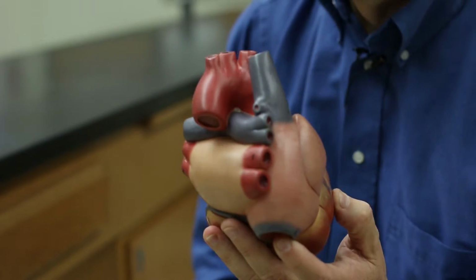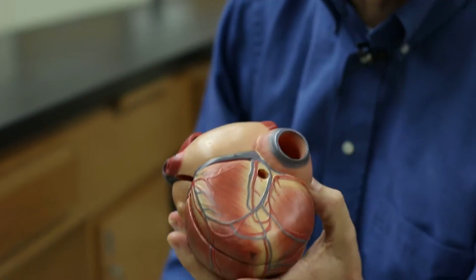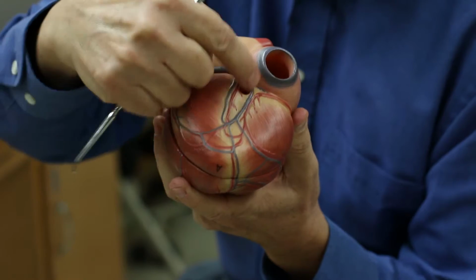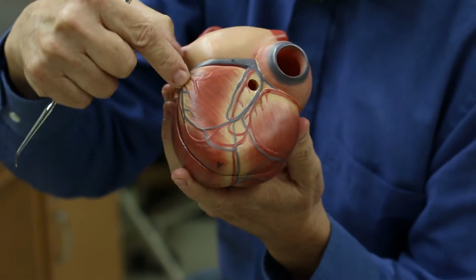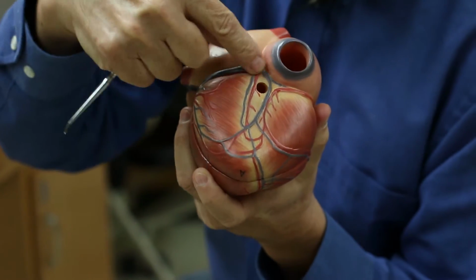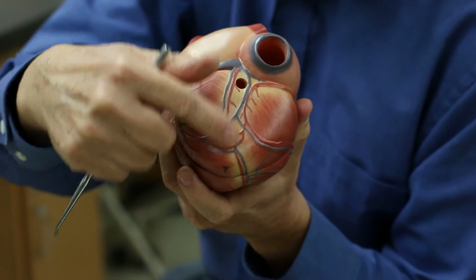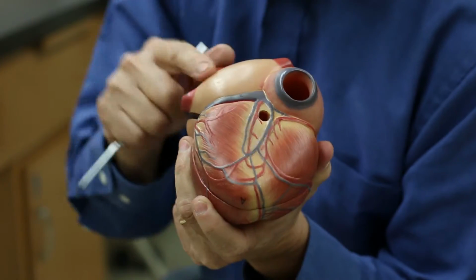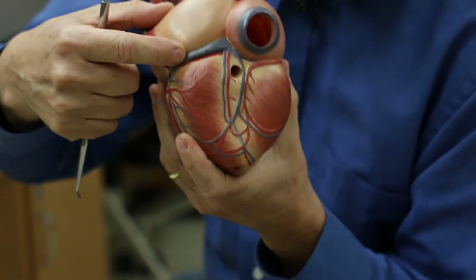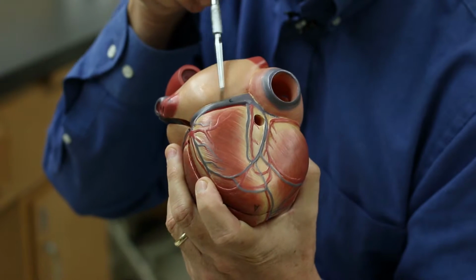Now you can also see evidence of where in the back there is another sulcus where the 2 ventricles meet. There's a little indentation there, and you can also see where there are blood vessels that run through there. This is the posterior interventricular sulcus. There's also another area where the ventricles and the atria meet. It's also a spot where blood vessels run on the outside. There's a very large vein here.